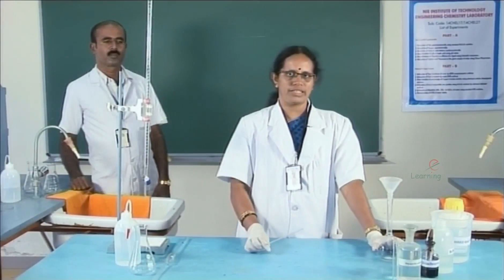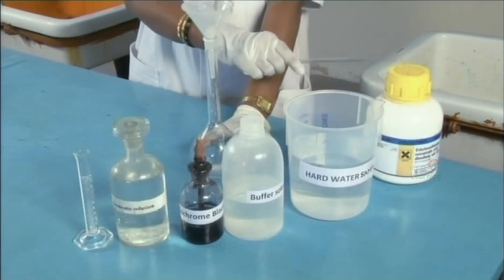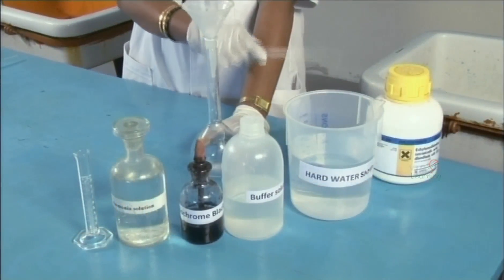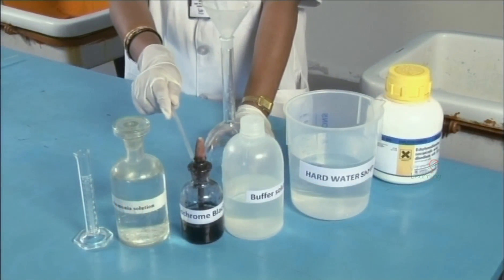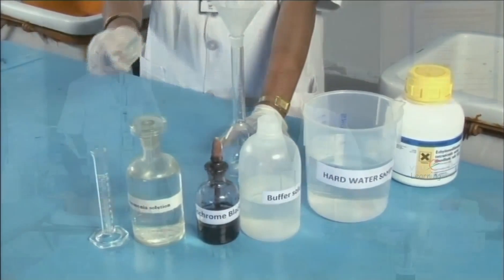The reagents used for the experiment are: disodium salt of EDTA, water sample, buffer solution, indicator EBT, and ammonia solution to dissolve the sample.